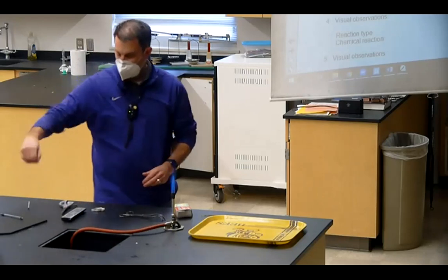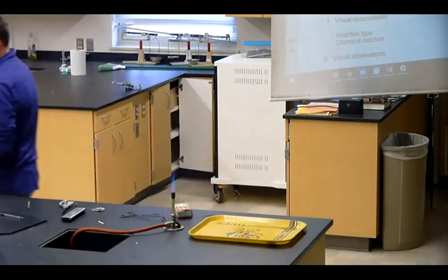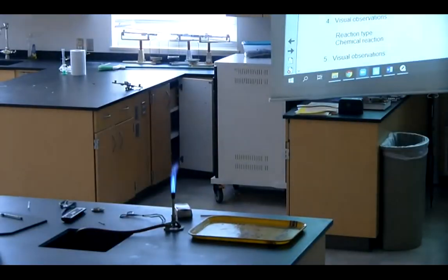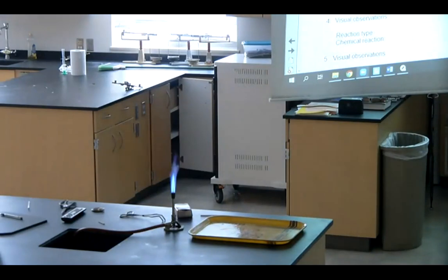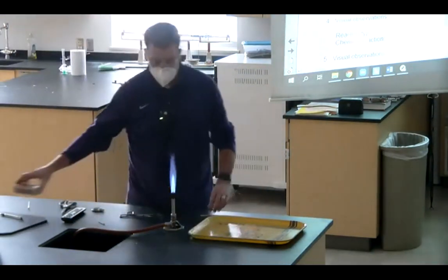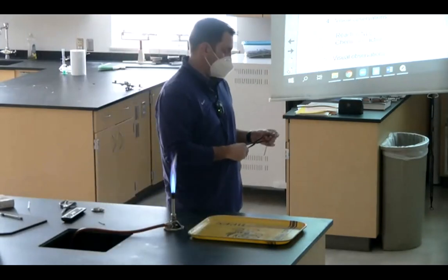Okay. Now, it is super important that you don't stare at this reaction. You can look at it, but don't stare.